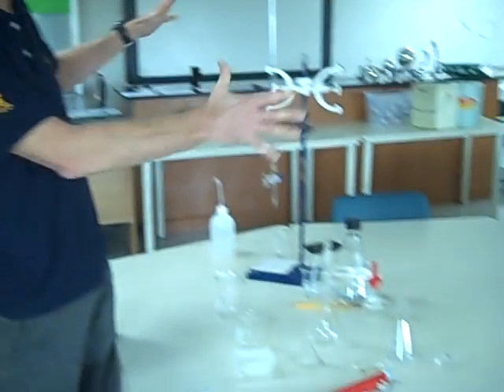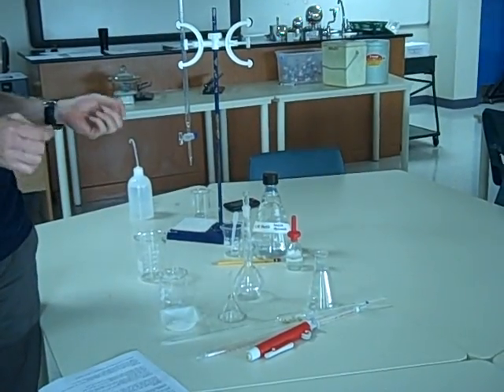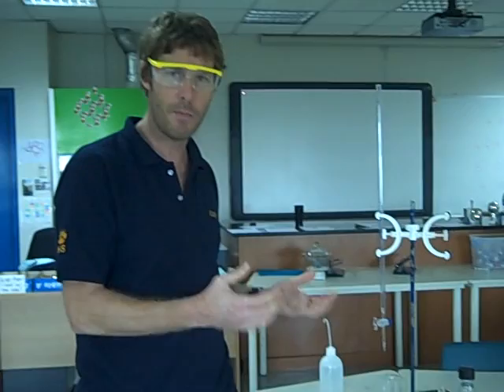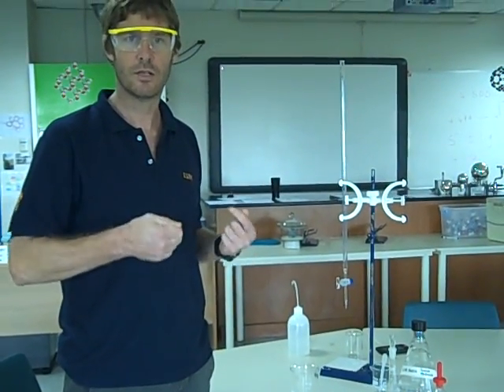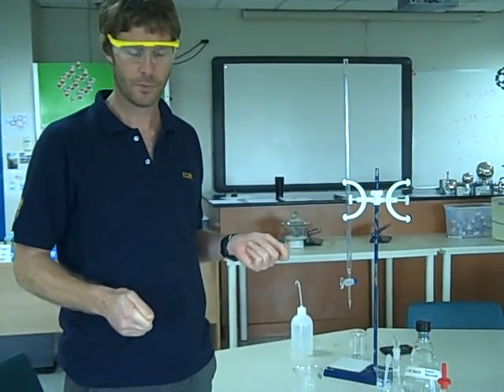Hello everybody, well here we are. I'm going to give you a brief introduction on how to carry out a titration because it might be the first time you've used any of these apparatus. The kind of apparatus here which is really specific, volumetric apparatus for measuring accurate and precise volumes of liquids.